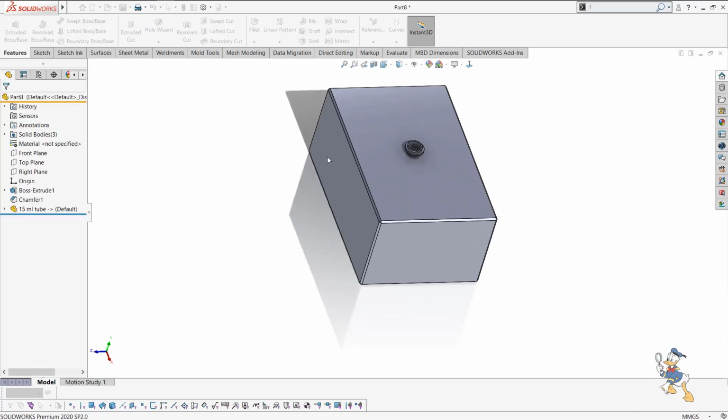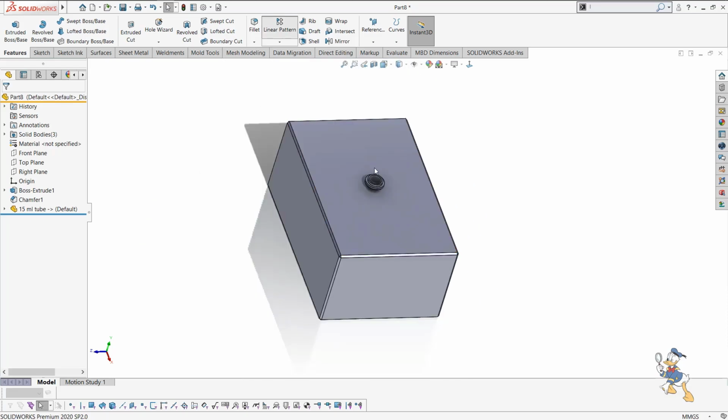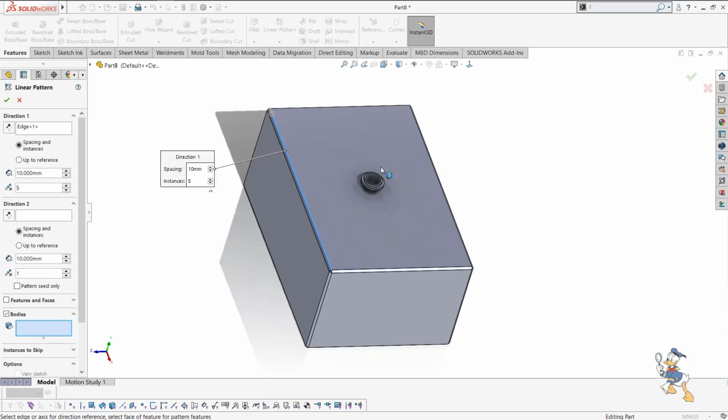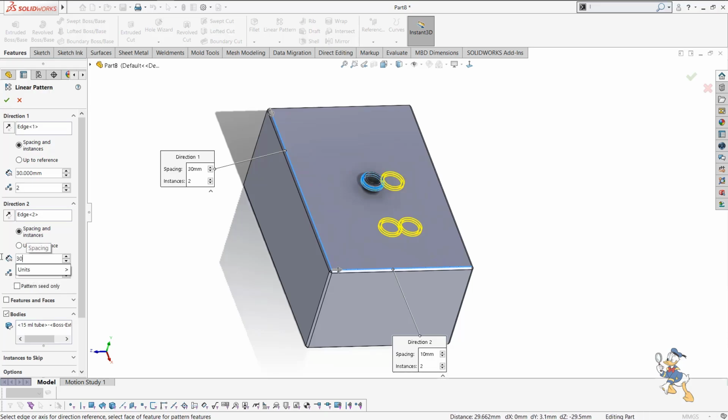Yeah, I just move it to the center of this body, and suppose I need to generate a pattern of this body. So I just need to select the direction and what will be the body of this to generate a pattern of this. It would be a testing tube, definitely. The instances would be like 2 with a value of 30, and the direction would be again 2 with a value of 30, or it would be like 20.